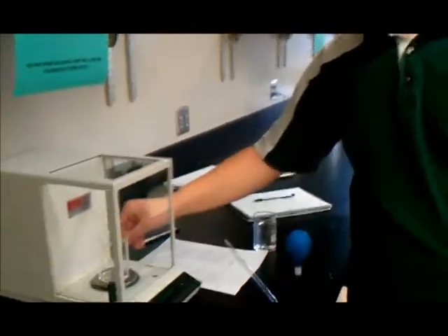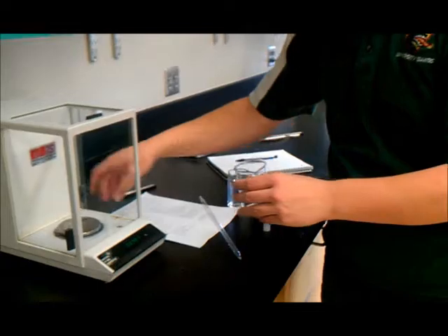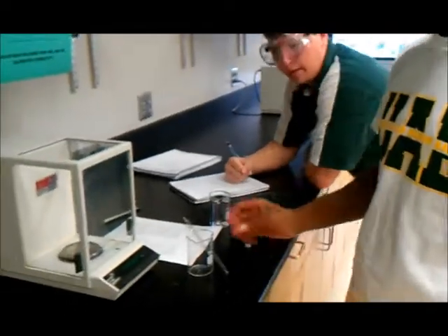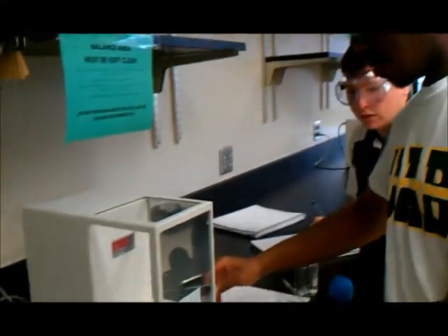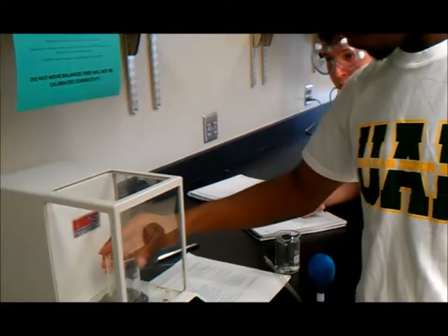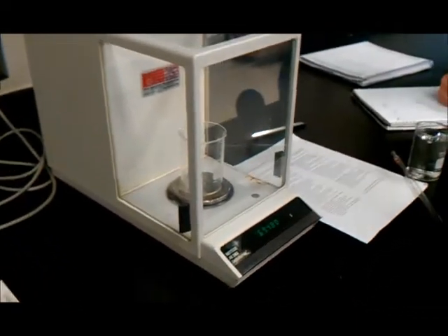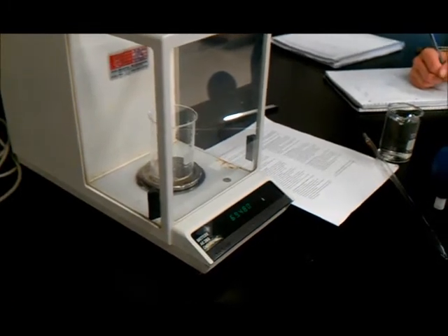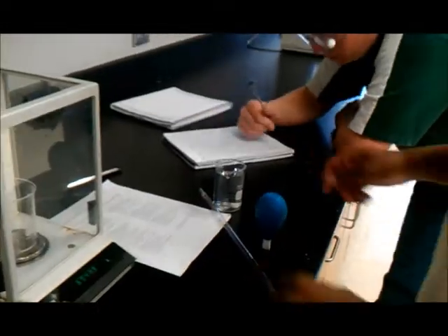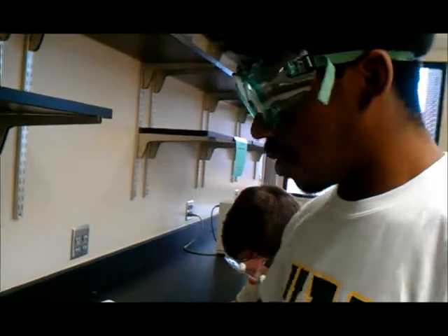And now I'll take out the beaker with the water in it and I'll tare the balance to get it back to zero. First, we should accurately measure the mass of the beaker. Zero the machine. The readout appears to be 69.480. Once that has been completed, we shall use a pipette to transfer a desired amount of water to the beaker.